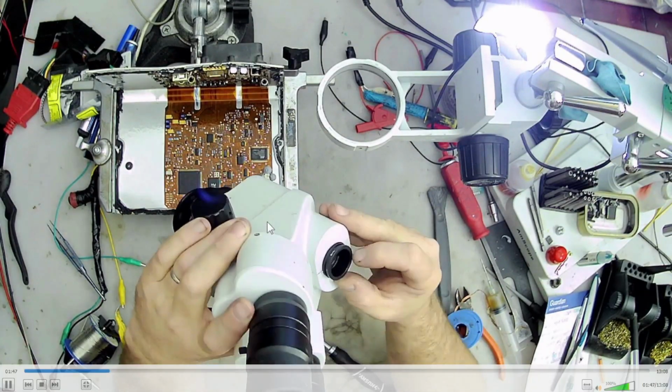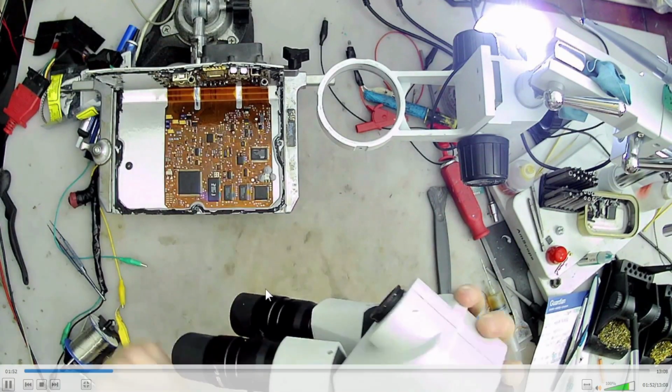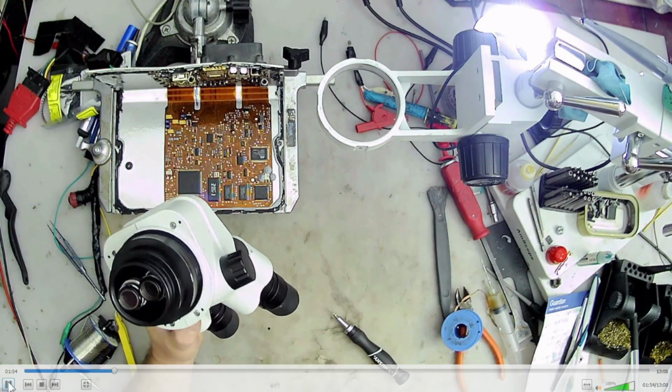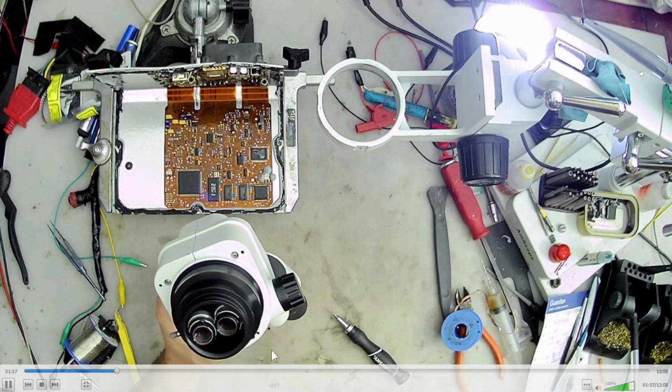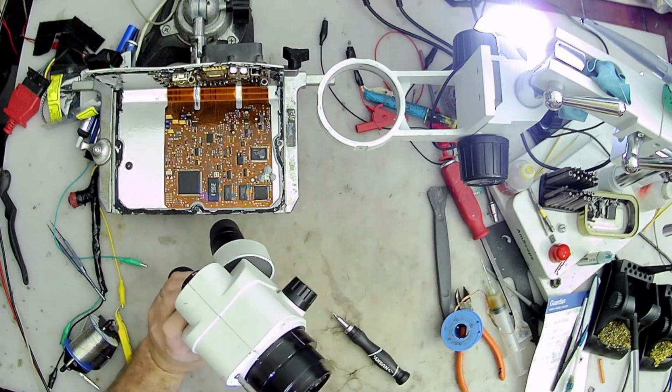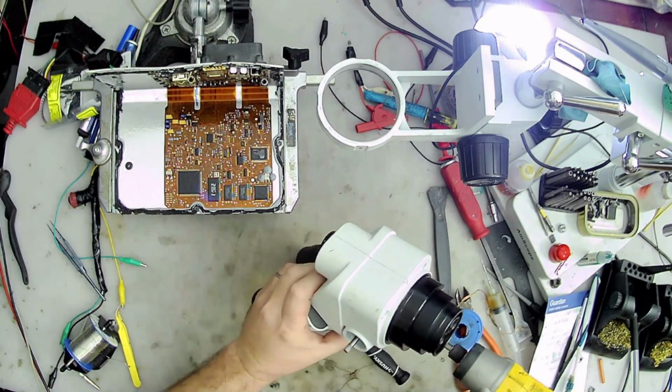Let's see, and then we have some screws that are going to be on the bottom. So here we go. There's four screws. There's a screw here, here, here, and here. And then those little small four screws that I was talking about earlier. And then the handle. That's pretty much all that's holding this case together. So it's pretty simple to take this thing apart.